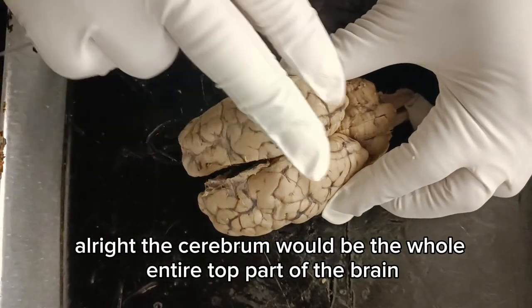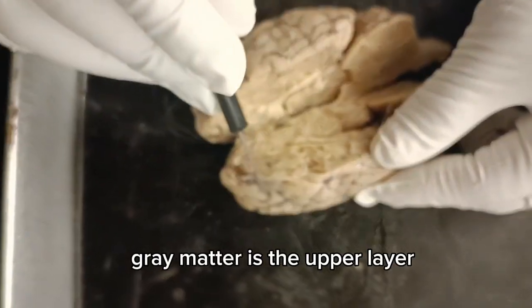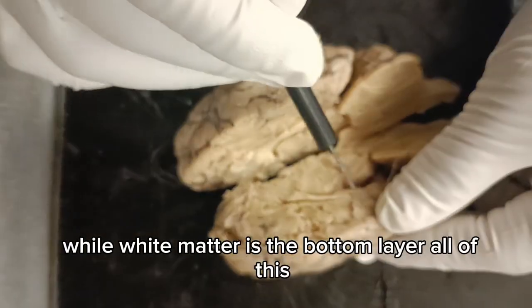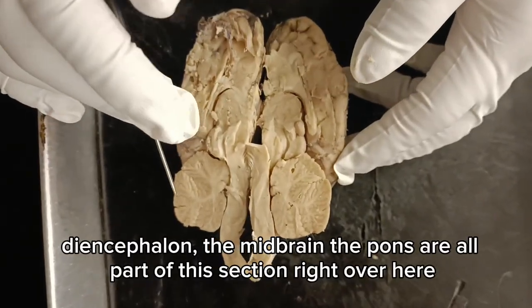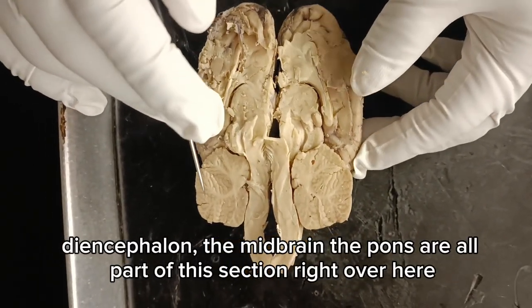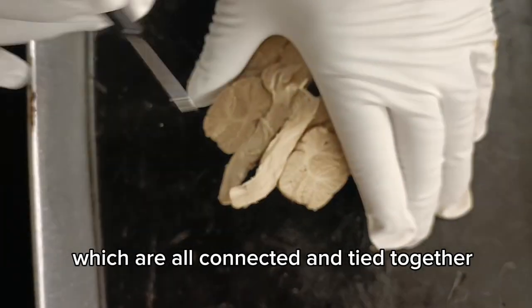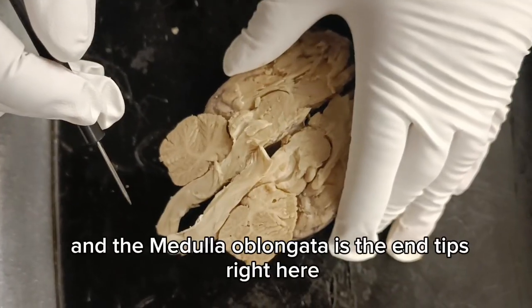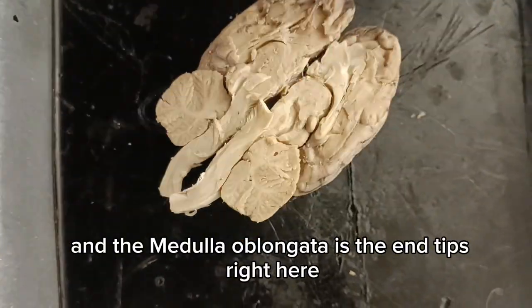Alright, the cerebrum would be the whole entire top part of the brain. Gray matter is the upper layer, while white matter is the bottom layer, all of this. Alright, the diencephalon, the midbrain, and the pons are all part of this section right over here, which are all connected and tied together. And the medulla oblongata is the end tip right here.